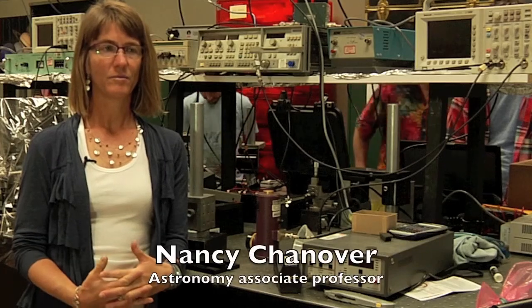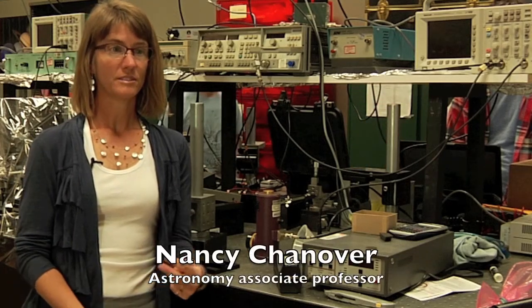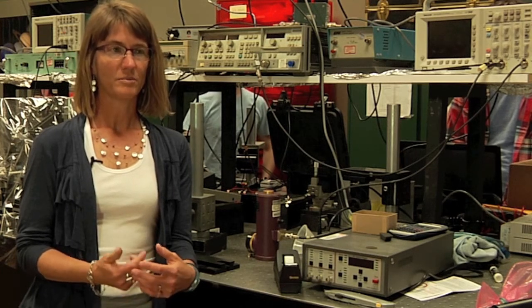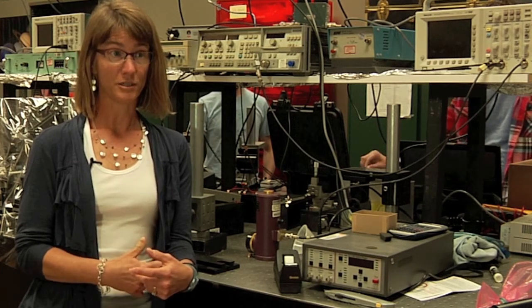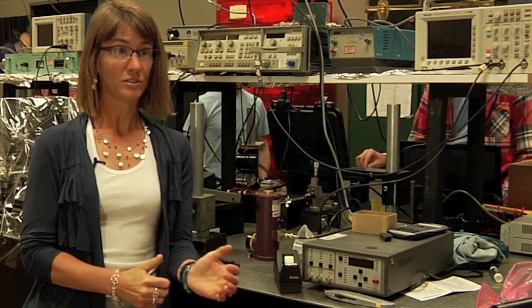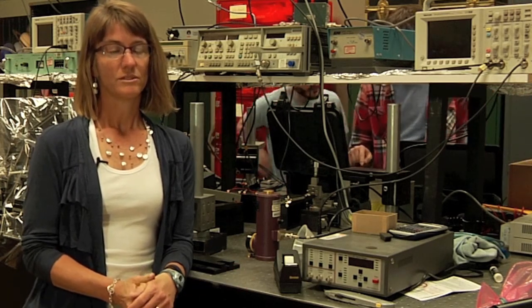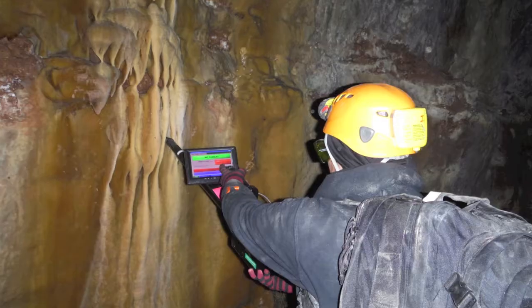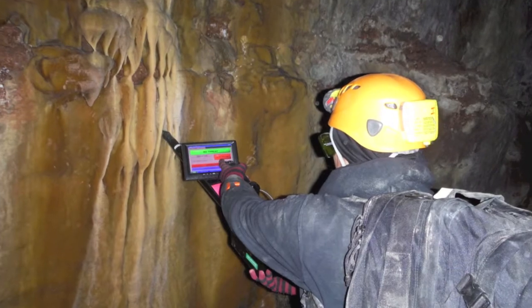The objective of the program was to use two different technologies, one of which we've developed through a partnership between astronomy and electrical engineering, and the other of which has been developed through the geology program, to look at samples of rocks in caves to see if we can identify signatures of life.